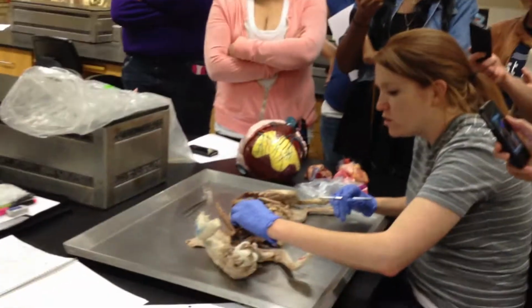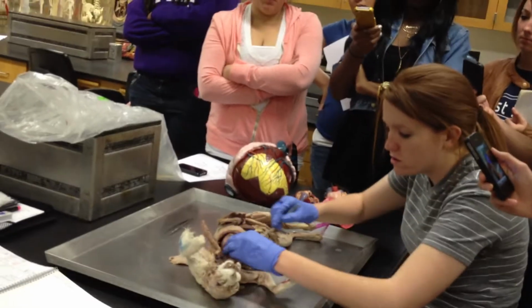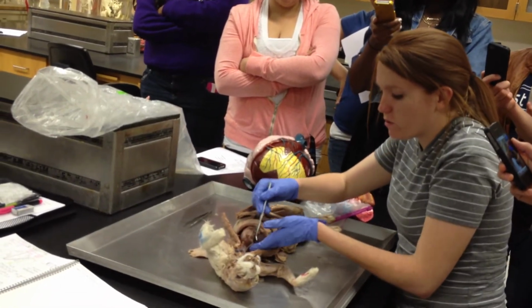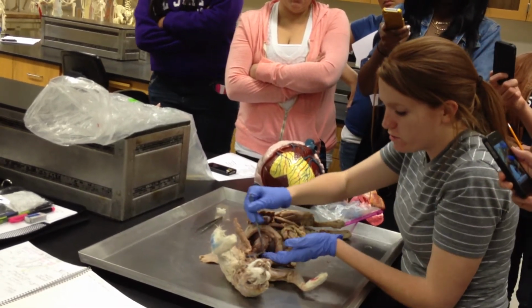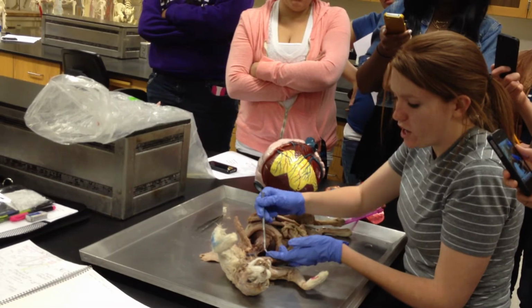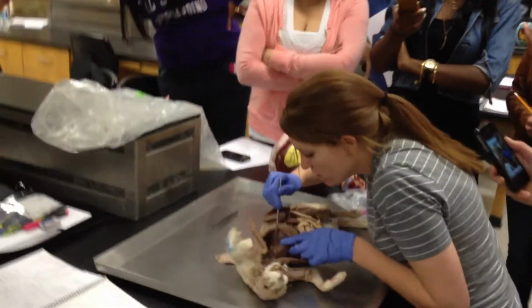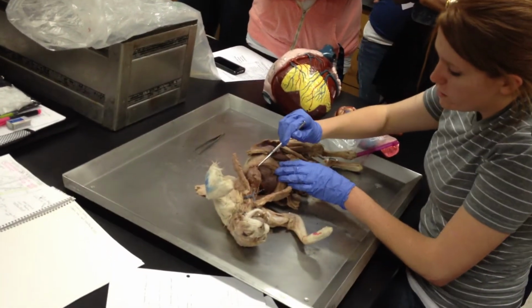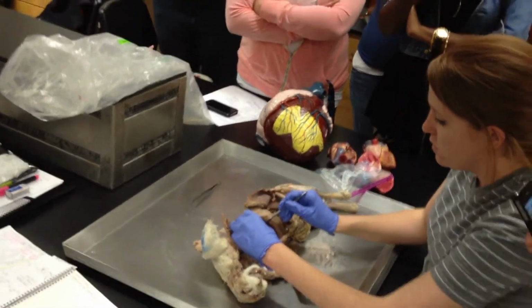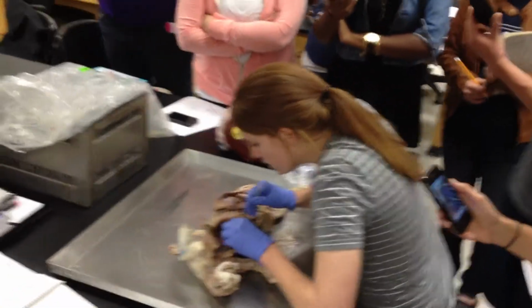You don't necessarily need to take the fibrous pericardium off of your hearts, but if you do, you need to be really careful because running right up on it is your phrenic nerve. The little floss-like thing here. You've got phrenic nerve on both sides. Everyone see it? We've got it here.